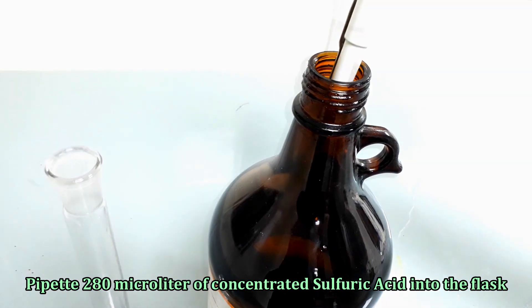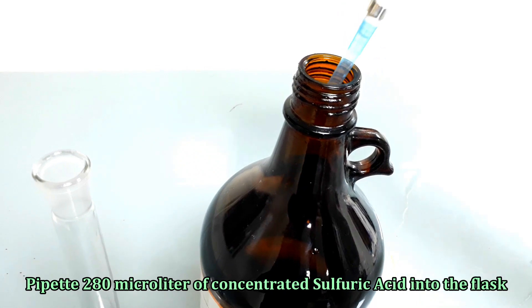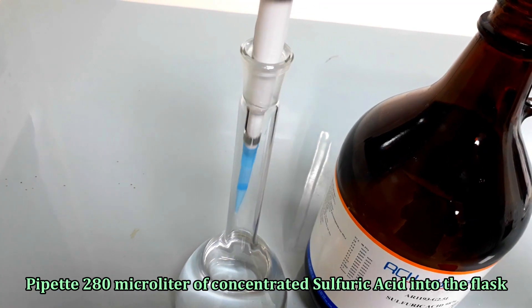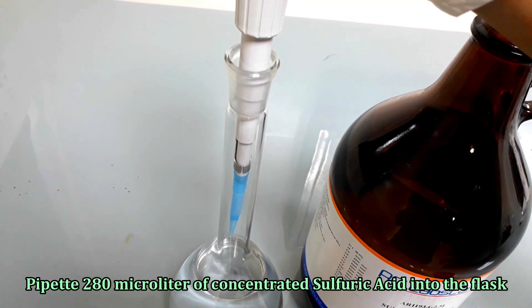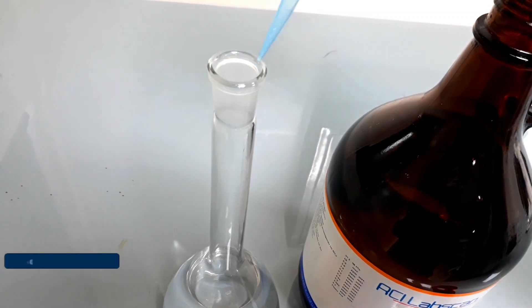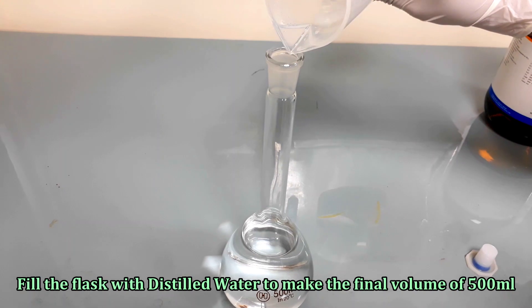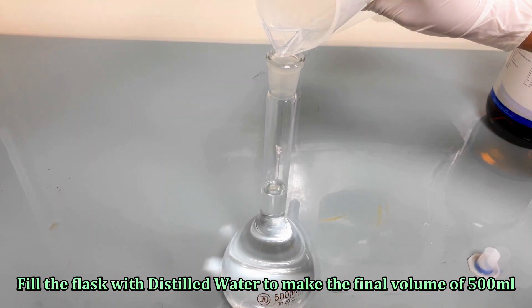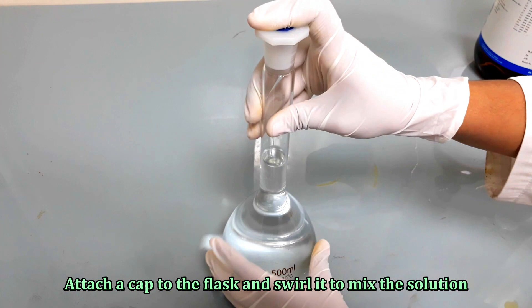Now, pipette 280 microliter of concentrated sulfuric acid into the flask. Fill the flask with distilled water to make the final volume of 500 ml. Swirl the flask to mix the solution.